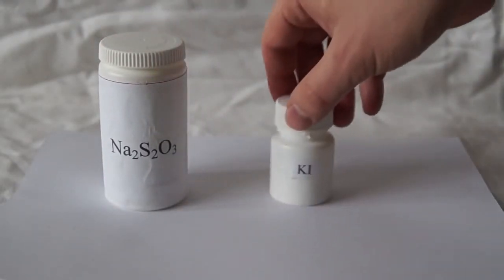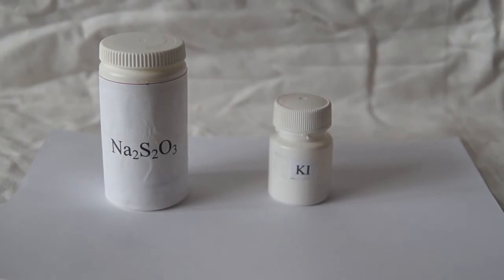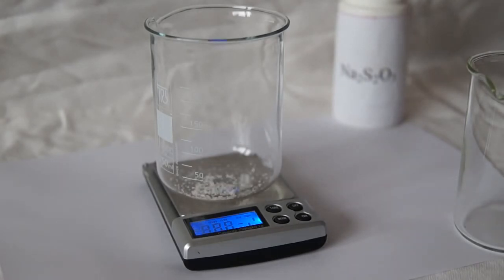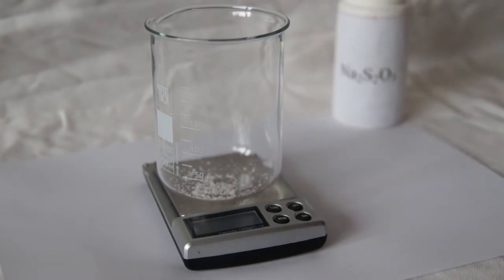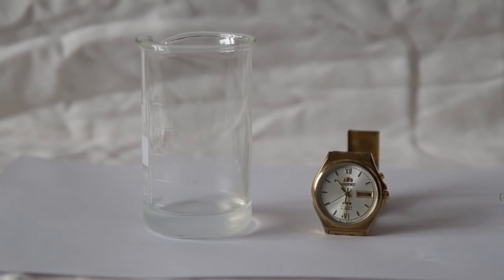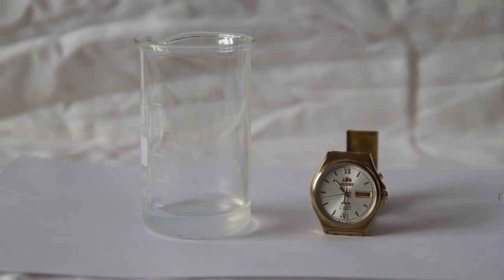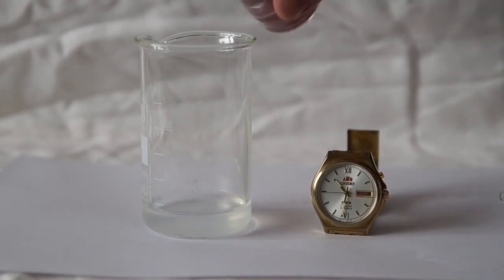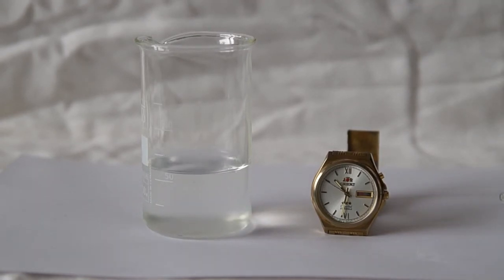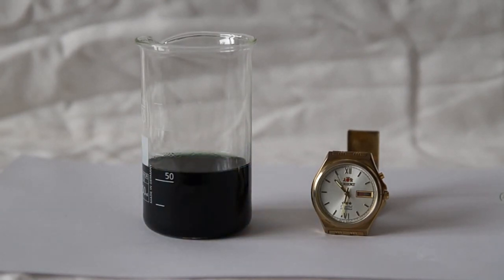Today we have a very unusual chemical reaction called Egyptian Night, or the simplified version of the chemical pendulum. First, let's take a beaker and pour there a small amount of potassium iodide, then dissolve the mixture to 40 ml. We now carry out the reaction — I set the clock so you can see how it occurs. In the main beaker I poured 20 ml of the first working solution, and now I am pouring the second working solution into the beaker. Time passes and the solution rapidly becomes black — the color change is the reaction between iodine and starch.